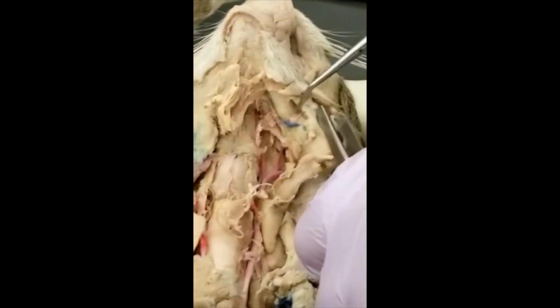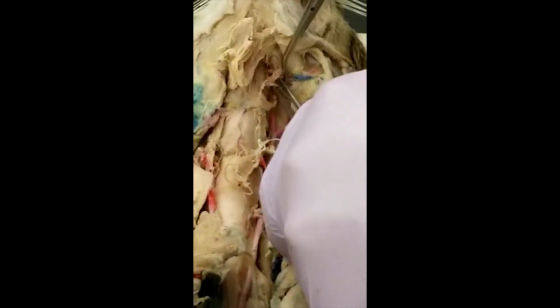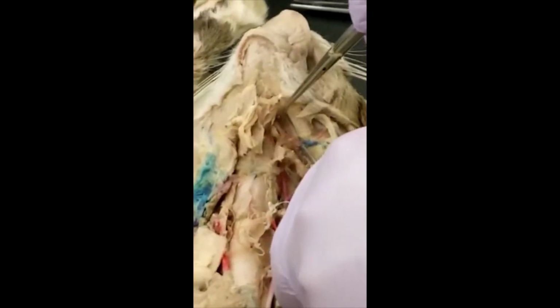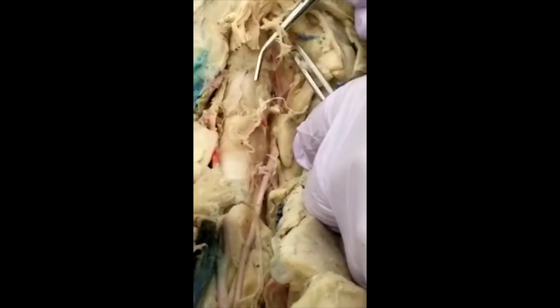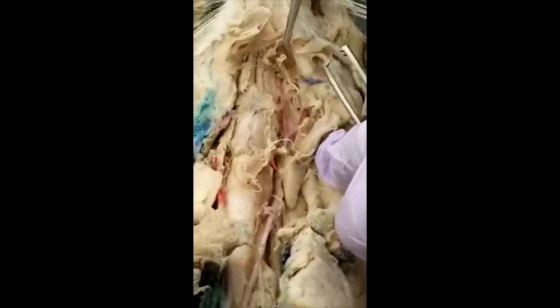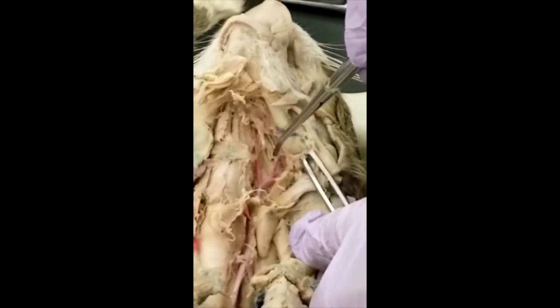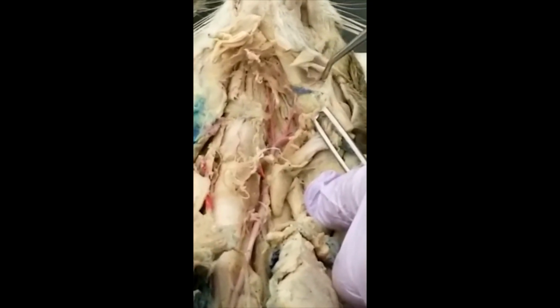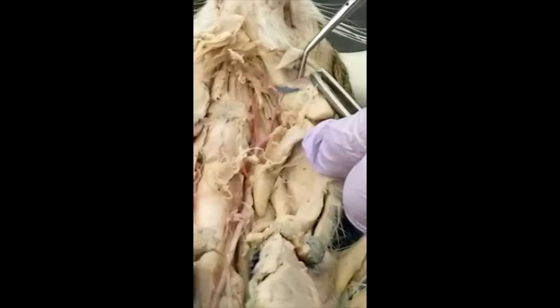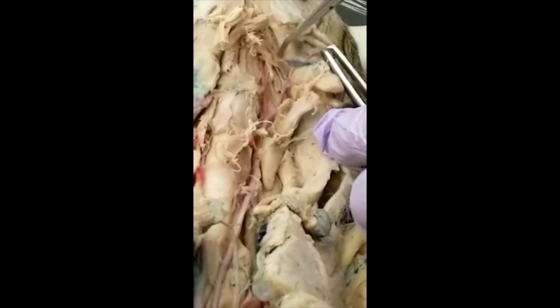So this vessel is the labial, and the submental is the one that's going underneath the mandible bone over here. You still see some traces over here. So that's the external maxillary. The labial going over here, you see the traces over here, that's the labial, can you see that? And the one underneath that is the submental.